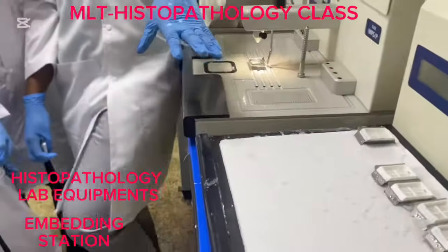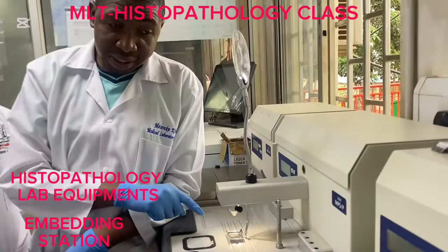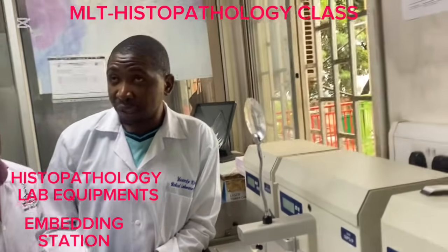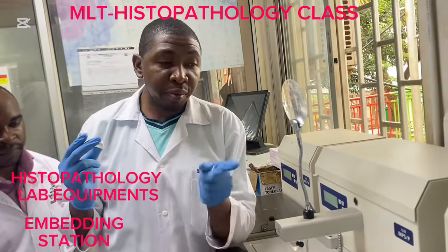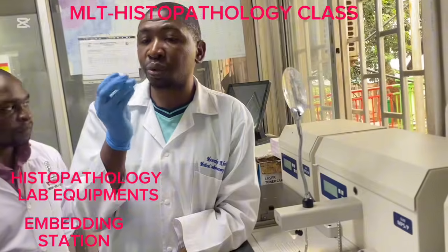Then the large cold spot. After completely filling our mold, we carry to the large cold spot, okay, for complete solidification of paraffin wax, so that we can separate the tissue block from the embedding mold to come up with a tissue block.